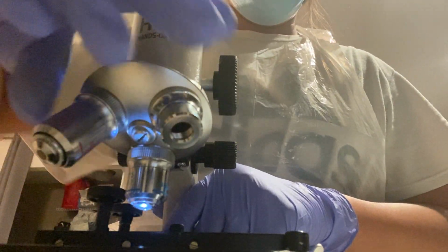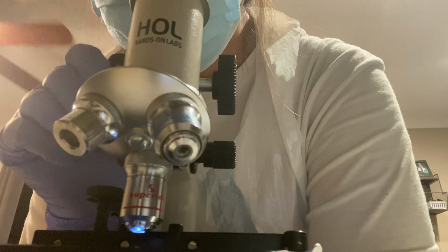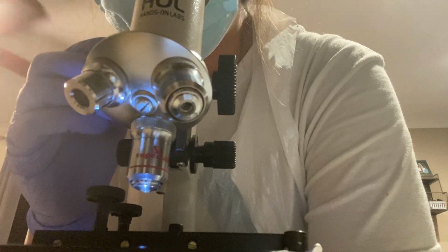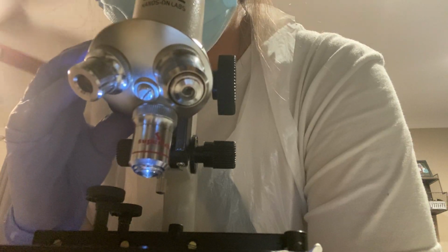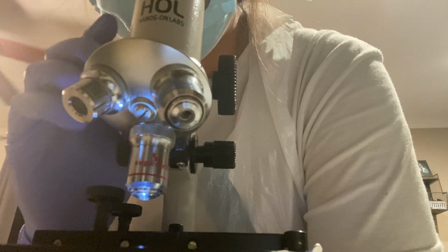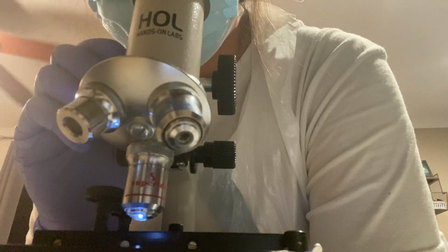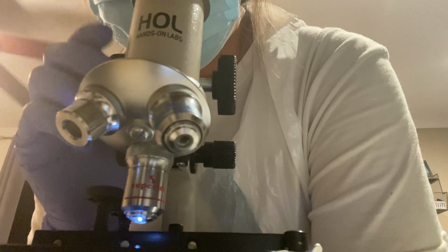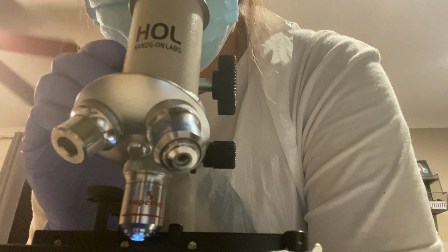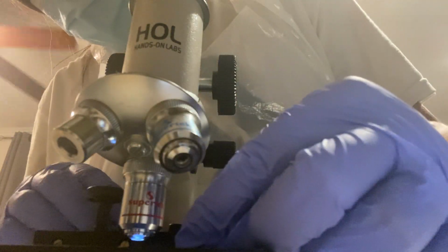Let me check high power. So these last two seem a lot harder for me to view for some reason.